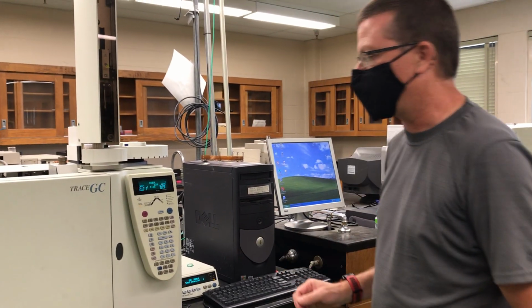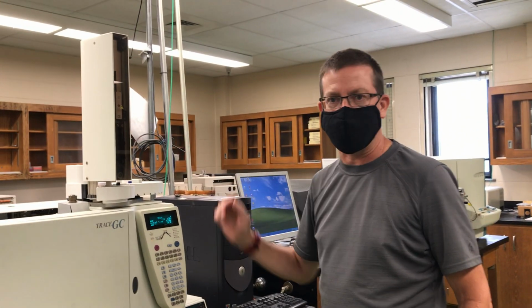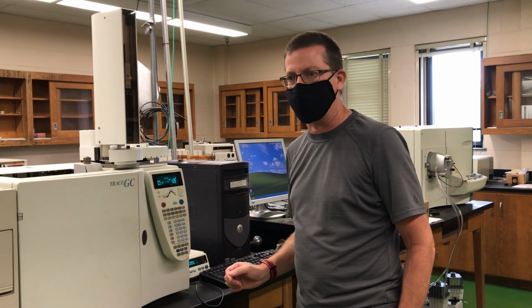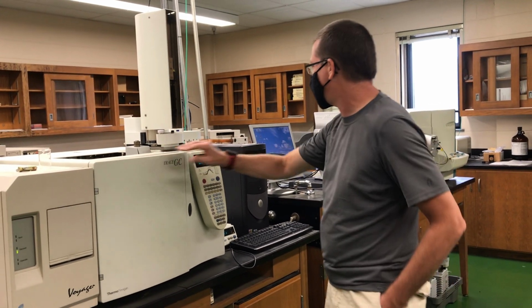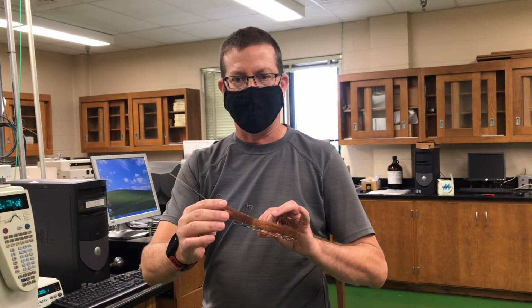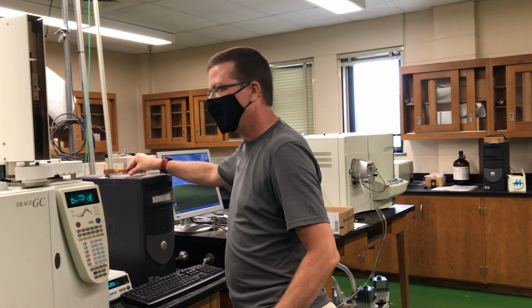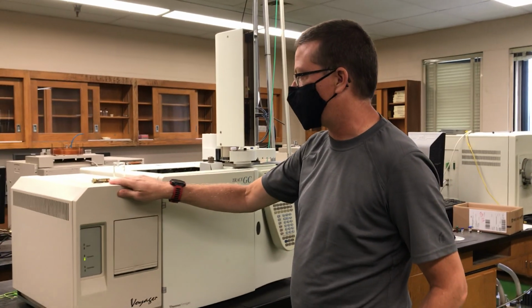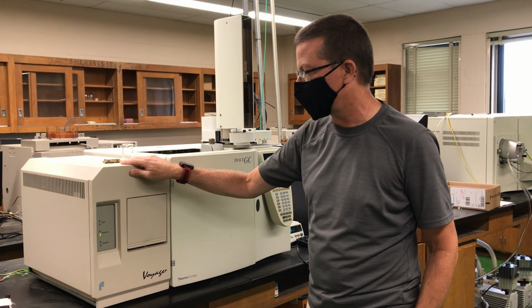So when you get right down to it, there are three parts to the instrument. We have the autosampler, which handles the injection of a sample into the gas chromatograph. We have the gas chromatograph, which thermostats an open-bore microtubular column, such as this, where separation of complex mixtures in the gaseous phase will occur. And then finally, the mass spectrometer portion, which acts as the detector for the gas chromatograph.